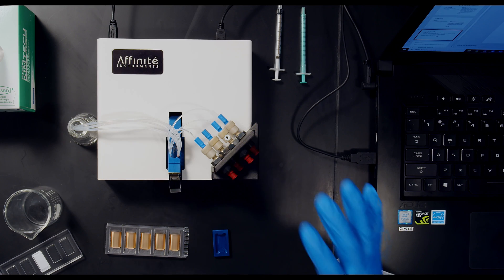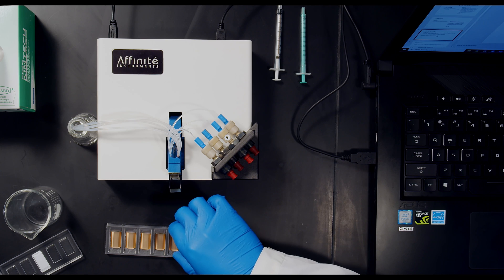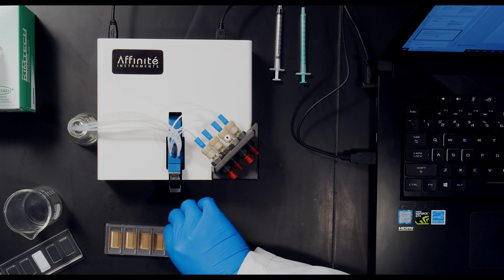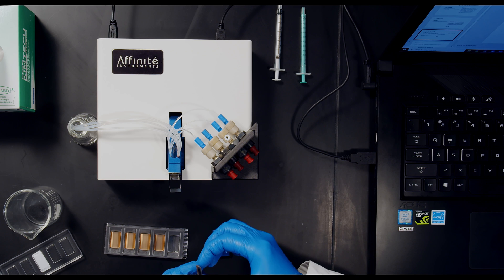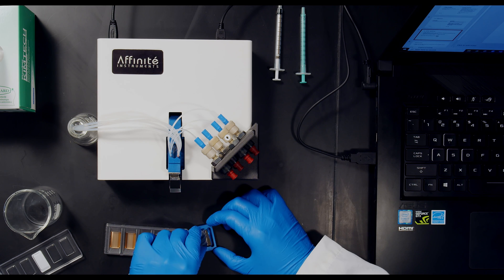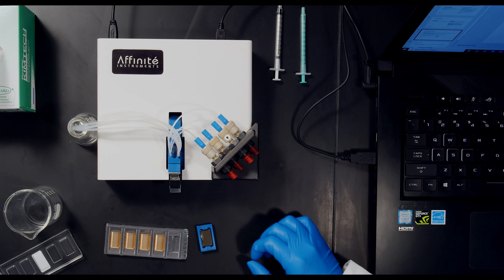And then with gloved hands, take a gold sensor chip, handling it only on the short sides, grab it, and with the gold surface facing upwards, place it into the chip holder.